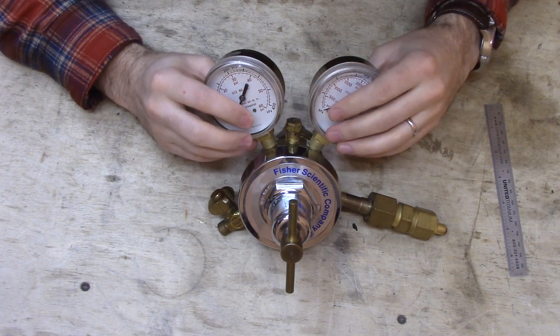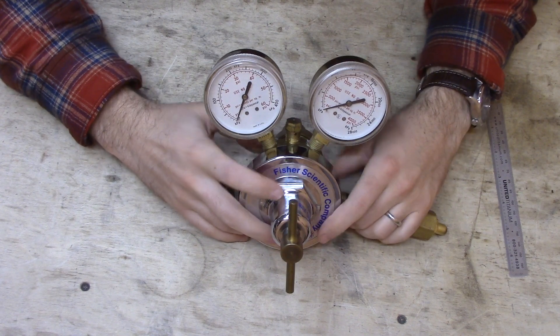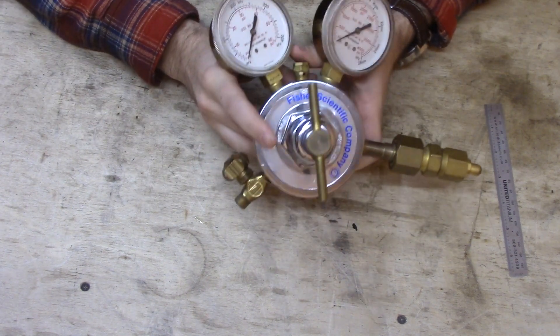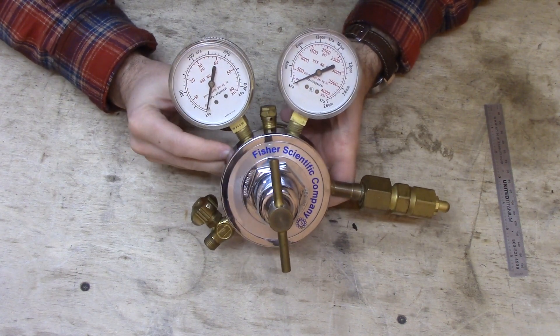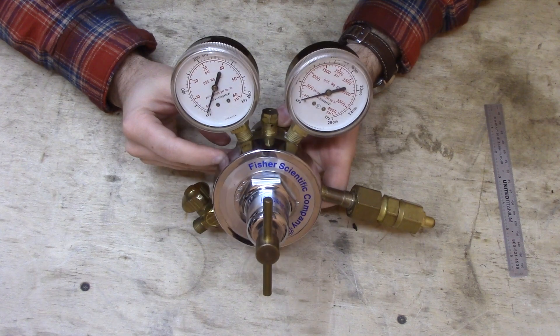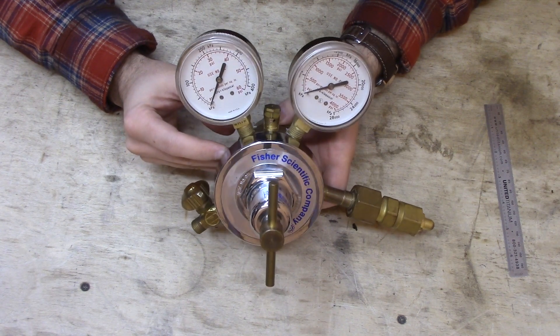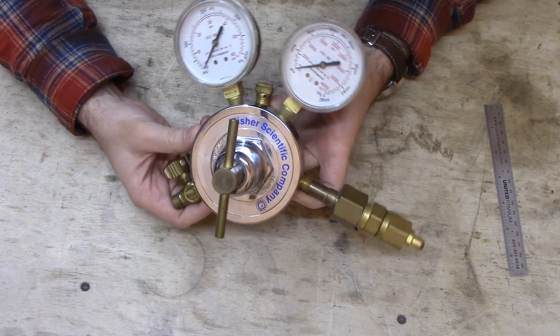Hey everybody, today I wanted to talk to you about this thing I have here. It is a gas regulator. This is one I got at a surplus sale. I tried to sell it on eBay and no one wanted to buy it, so I thought I'd take it apart and see how it works. It looks really expensive just from the heft it's got.